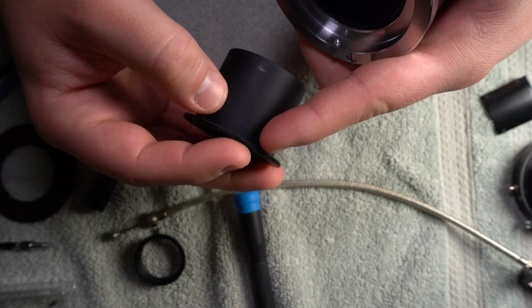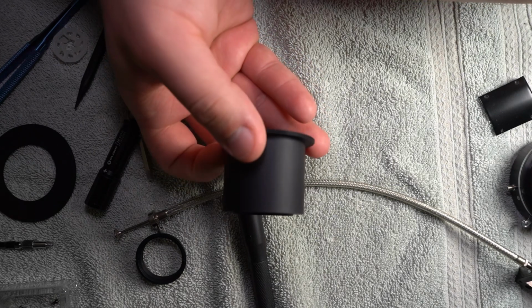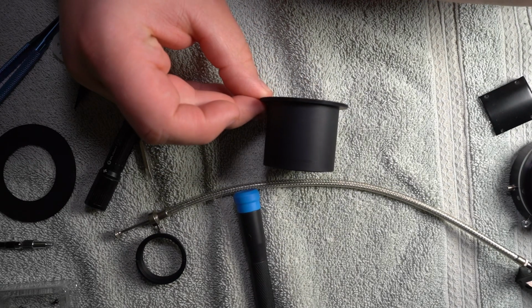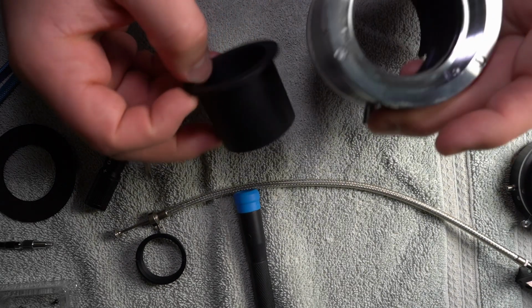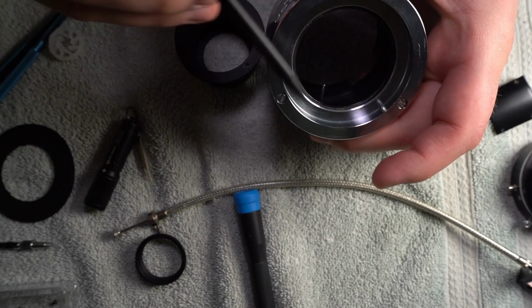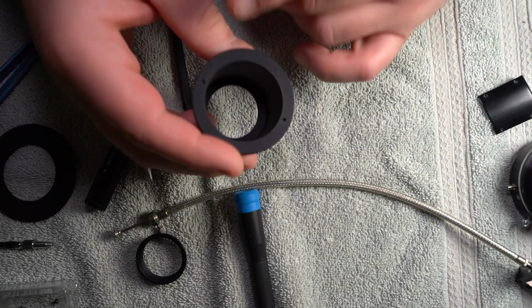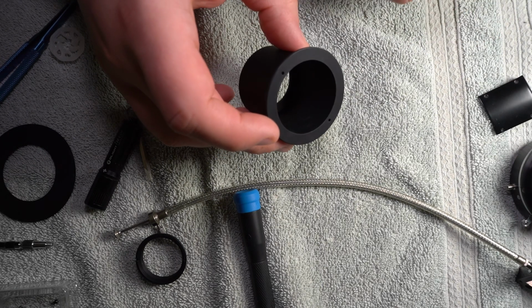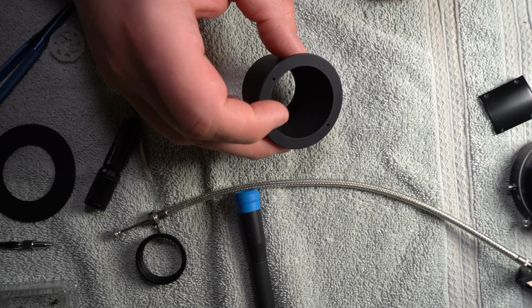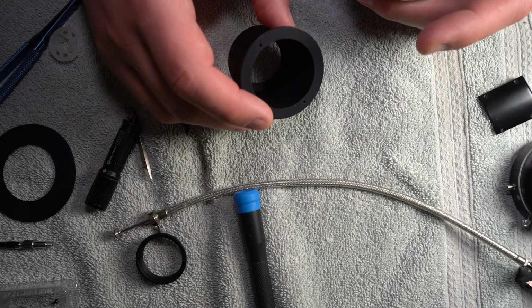Take this. There are very small threads on the outer edge of this little part of this top hat looking thing. That actually looks a lot like a top hat. Anyway, on the rim of the hat, there are threads and they actually correspond with the grooves here. There's a tool that kind of goes across the, can you see? Yeah, you can see the holes now. There's a tool that fits into those, and it's called a spanner wrench.